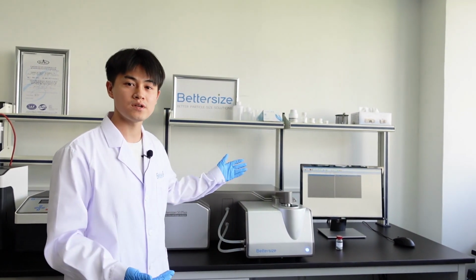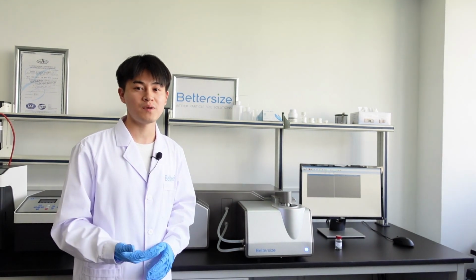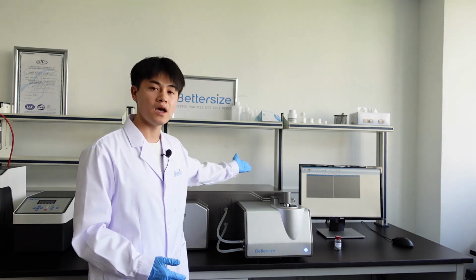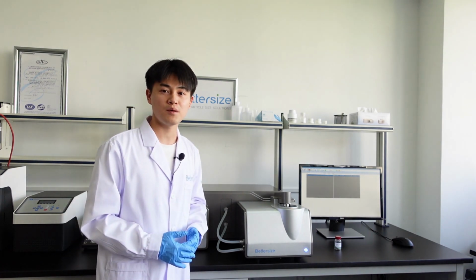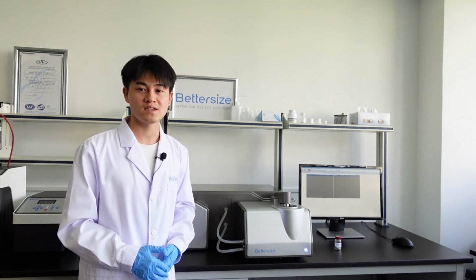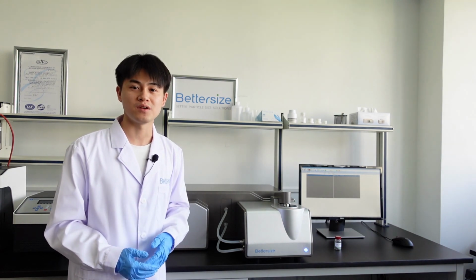More importantly, the Bettersizer S3 Plus also has an image analysis system. It offers two CCD cameras, including 0.5-fold and 10-fold magnification lenses that capture around 10,000 particles per minute. Therefore, at the same time during the measurement, the LED light is irradiated to the particles and then imaged by the CCDs. Then the high-speed data cable will transfer these images to the software for image processing and analysis to provide both particle size and shape information.